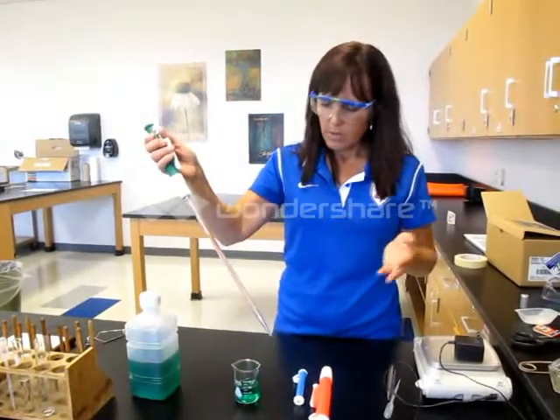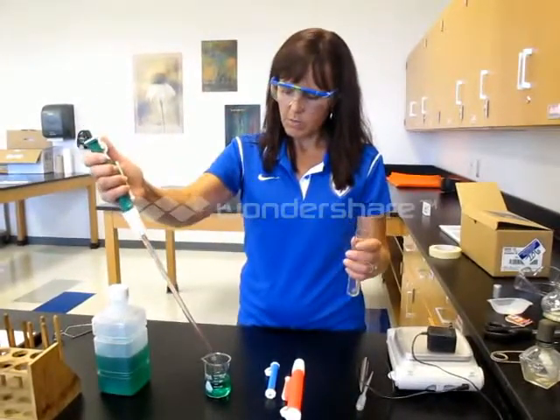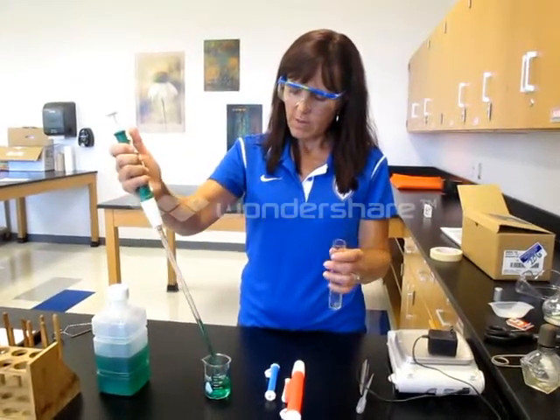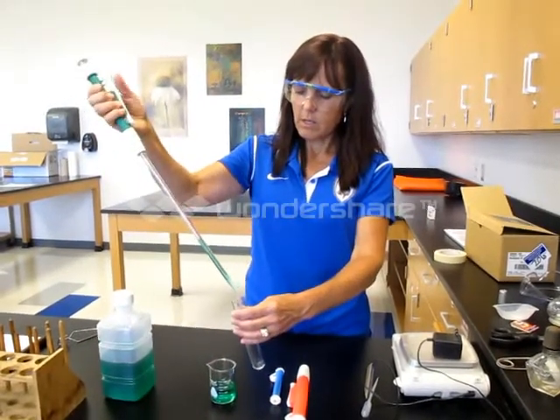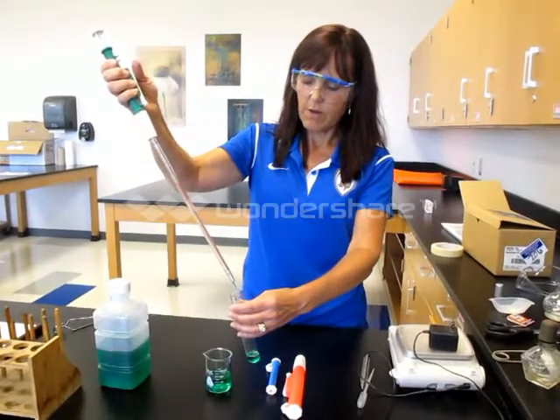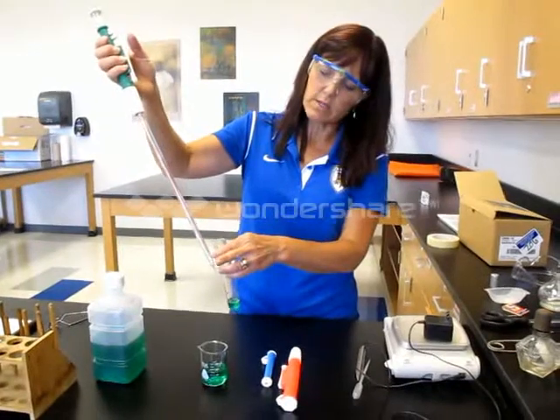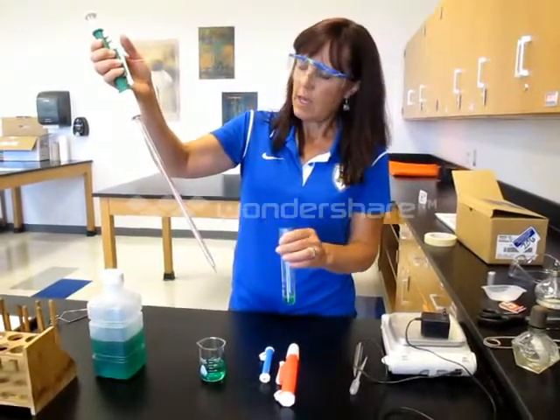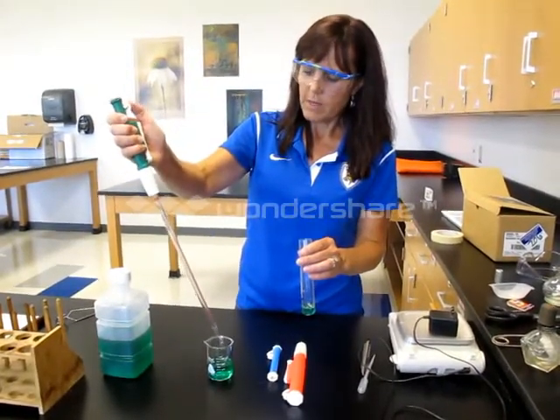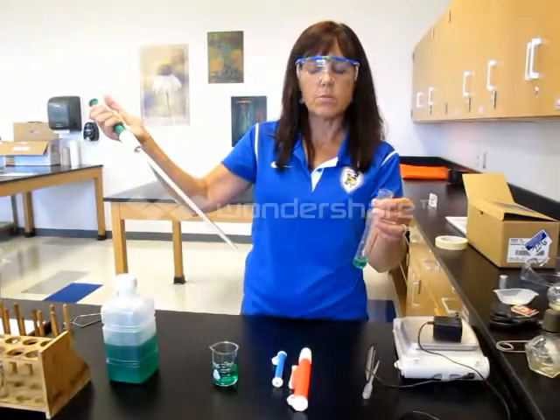Let's say I want to draw up about 5 milliliters and transfer it to my test tube. I put the pipette in the solution, pull it up, and stop at the 5 milliliter mark. I transfer it and use the release valve to release that 5 milliliters into the test tube. There is a little bit of liquid left in the bottom — they are calibrated as such, so just leave that in there. Then use the dial to return the pipetter back to normal. If at all possible, try not to touch that tip to either the test tube or your beaker to prevent any contamination.